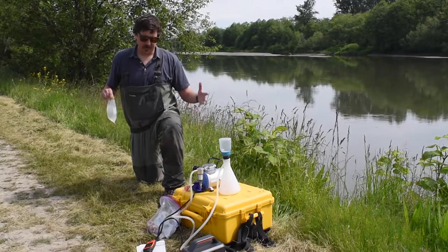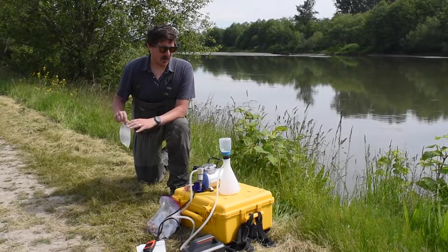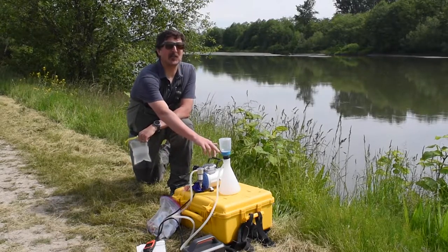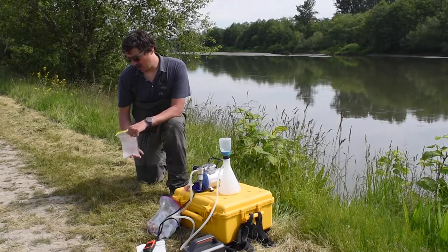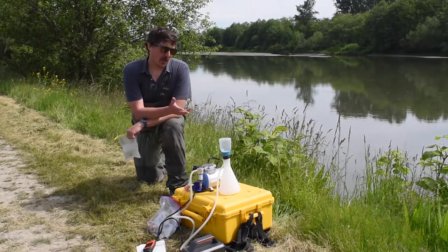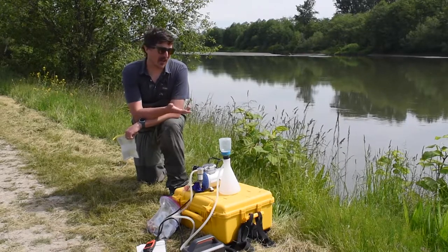This is a self-contained system we came up with through lots of trial and error. We're going to be taking this water sample and running — for brevity's sake we won't do a full sample here — but we'll run 250 milliliters to a liter of water through this filter inside this filter funnel. That very fine filter is going to capture any DNA fragments in this water sample. We'll then send this filter into a lab, and they will run it through a next-generation sequencing machine, which will conduct what's called a metabarcoding DNA analysis, and it will tell us everything that's on this filter.